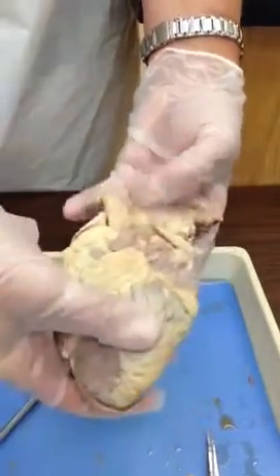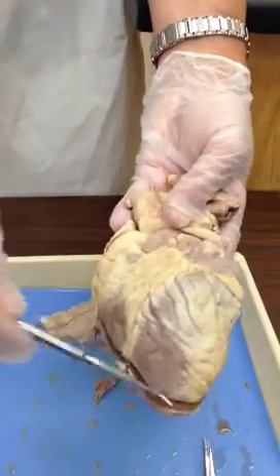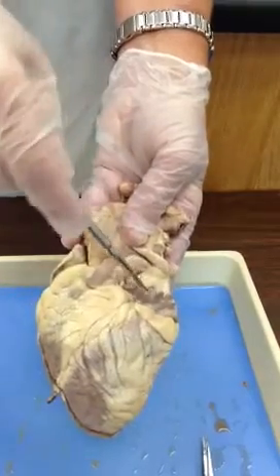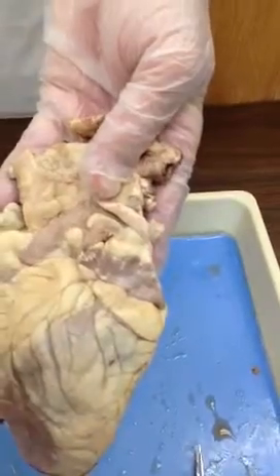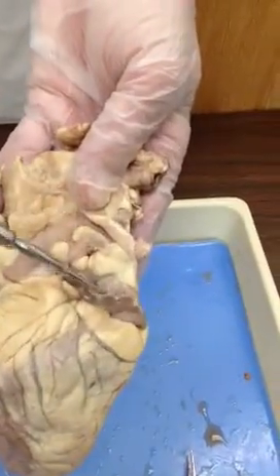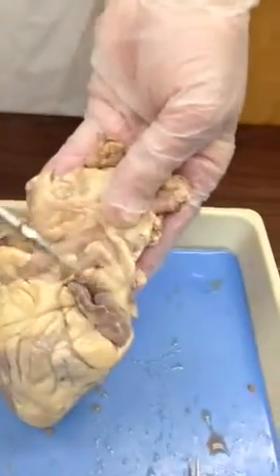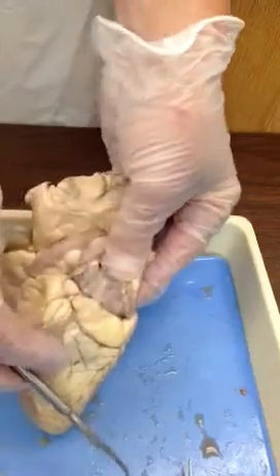And what about the small chambers? Those are called atria. Ventricles are the large chambers. Here's an atrium, left or right. This is left because of the apex, then that's going to be the left atrium. Remember, the flap that looks like an ear is actually called an auricle. The chamber itself is the atrium.